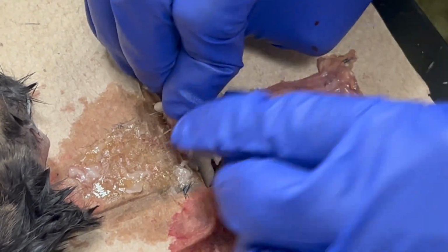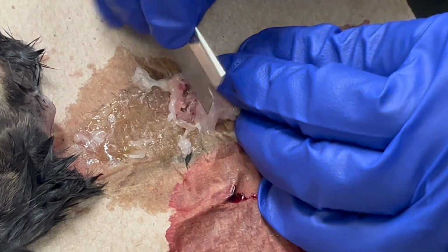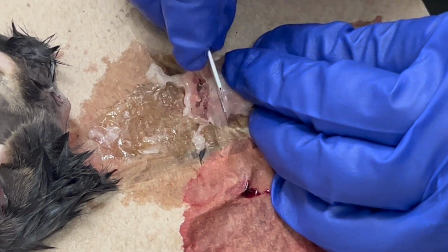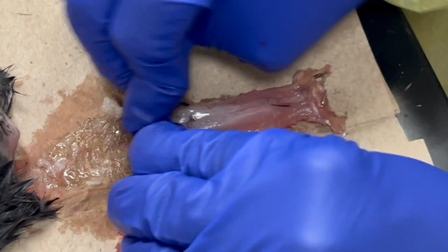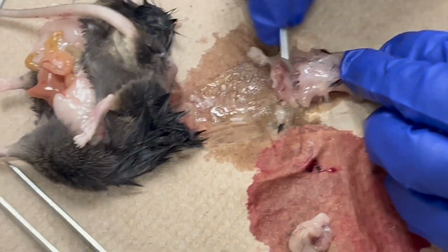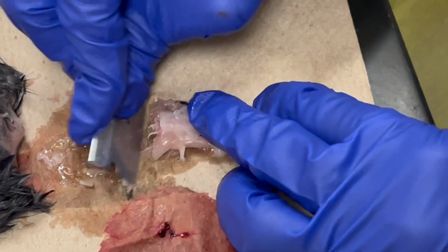You did perfect for me when you did the M60 950, so if we can simply reproduce that, that'll be great. No excuses. No, no, no. What I'm saying is we've got to get to a balance. What was the word? And the last one worked. It was really hot. Everything was melting. It was terrible. And the room was hot too.